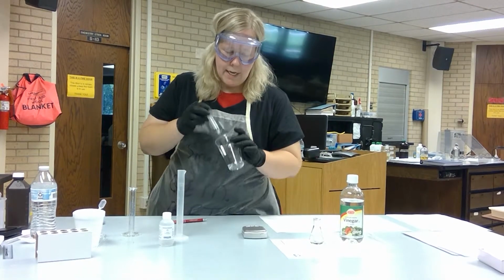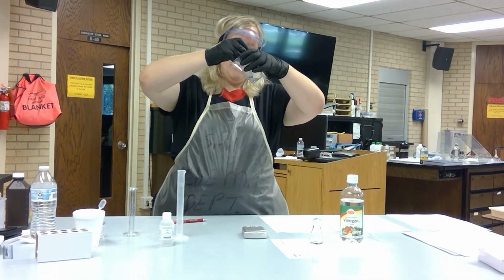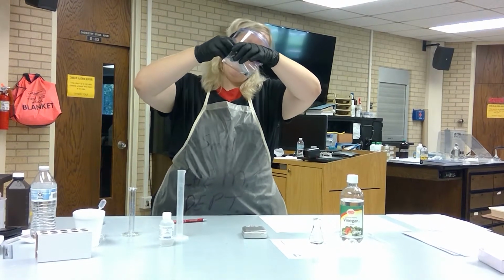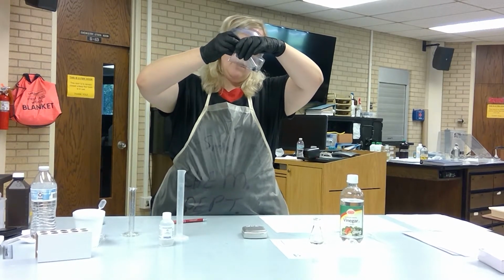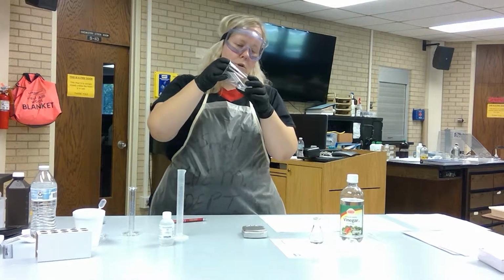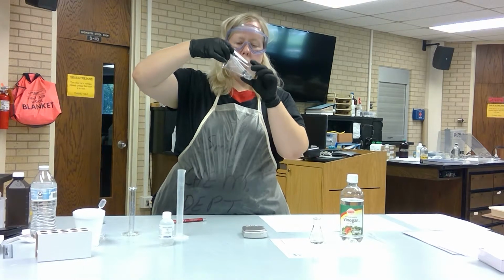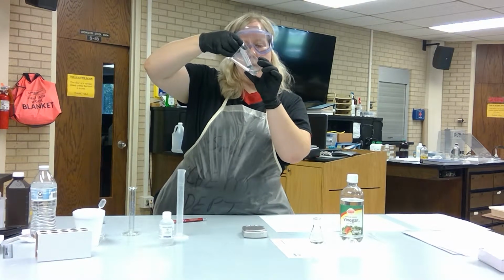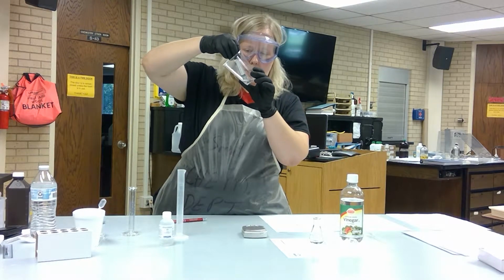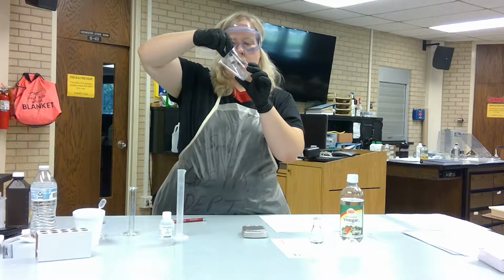Now, you're going to want to take your syringe and put it into the cup. And you want to minimize as much air as you can. Okay. So I'm going to put the tip of the syringe into the sodium hydroxide, and I'm going to pull up. If you get an air bubble, go ahead and push it back down, and that should dislodge the air bubble, and pull that back up, and you should see that air bubble disappear. If you need to do that a couple of times, you can. You can also flip the syringe over. Flipping of the syringe is a common technique.